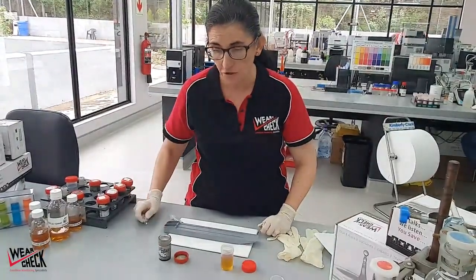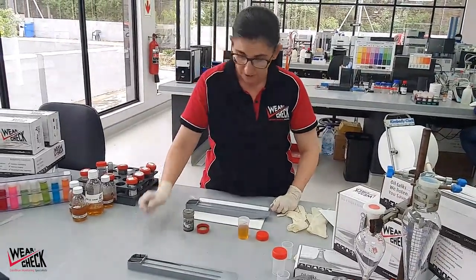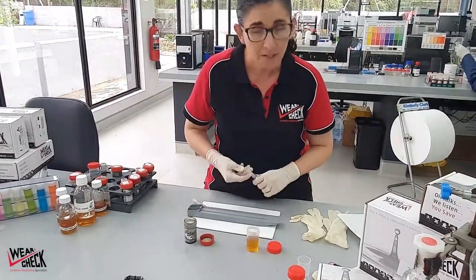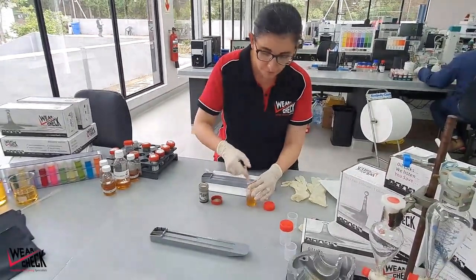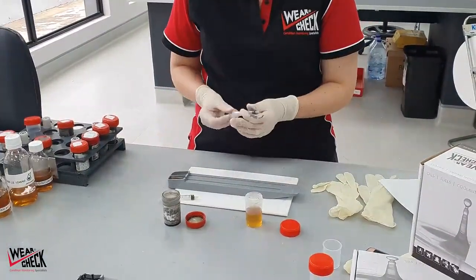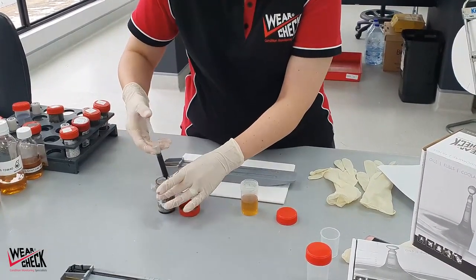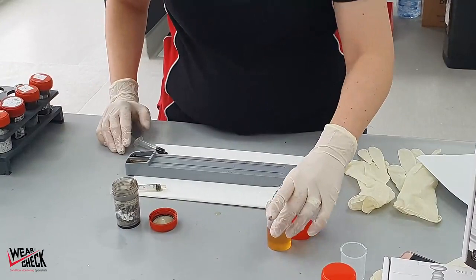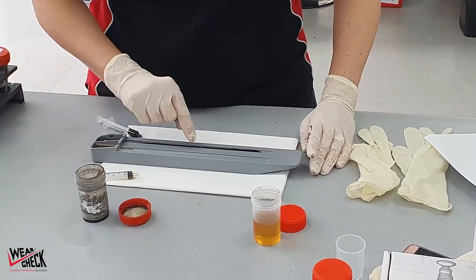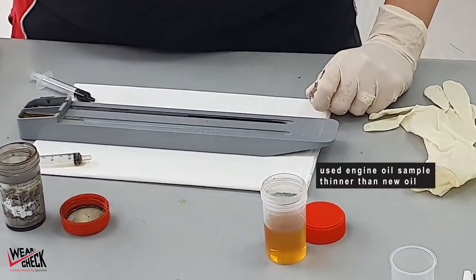Now to show you the inverse of what I've just shown you. That was an example of a used oil that has a viscosity much higher than the new oil value. What we have over here is a sample that is quite thin because it contains fuel from fuel dilution. As per the first set of instructions, take a sample of the new oil and put it into the oil reservoir, then take a sample of the used oil — once again you want to get the same amount. Now tip over the rheostik until it rests on its base, watching until the oil passes the midpoint. This is an example of a used engine oil that is considerably thinner than the new oil sample.